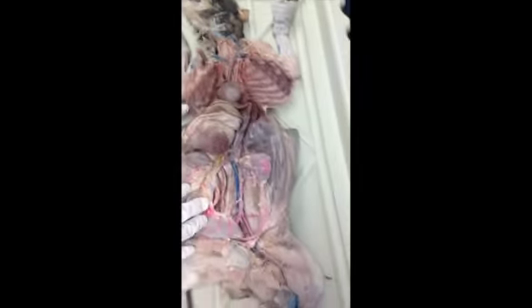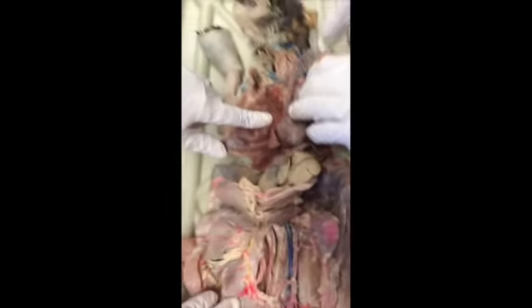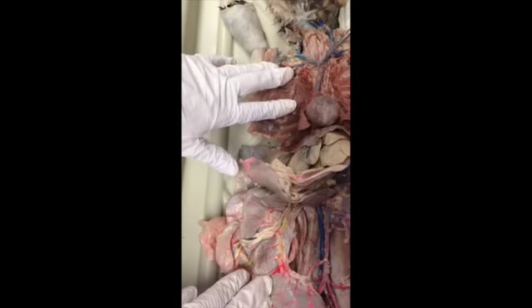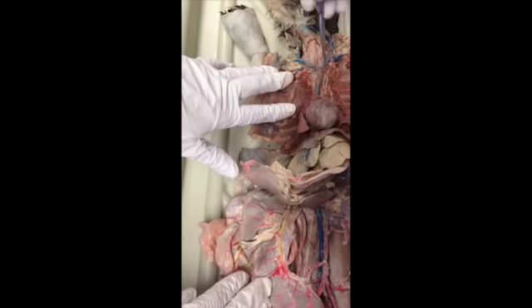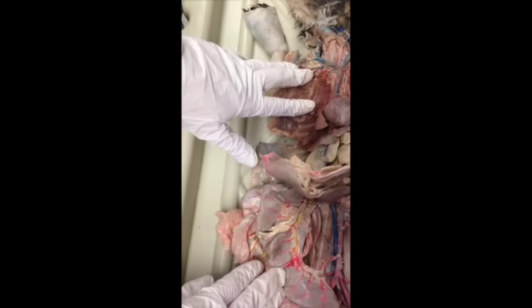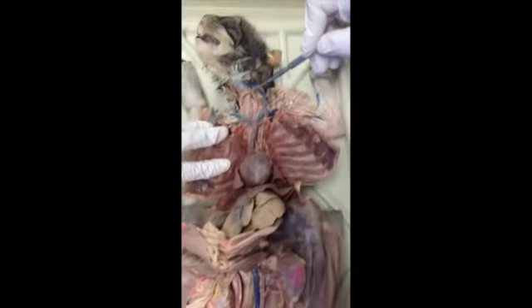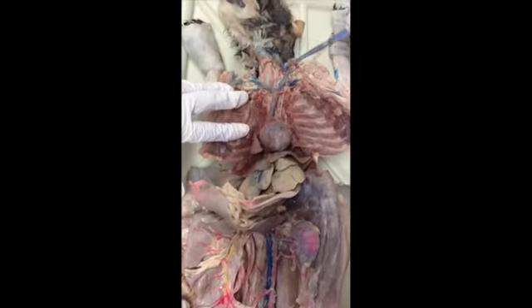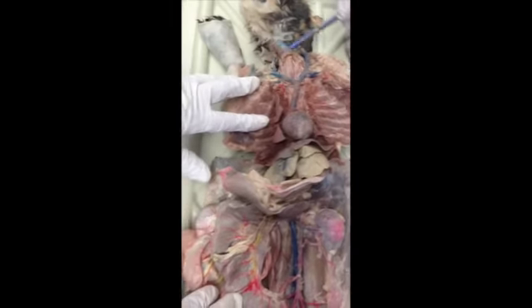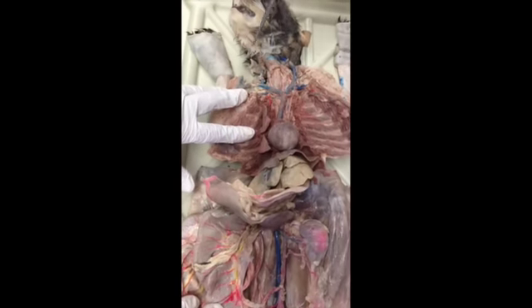Okay, let's go to veins. Coming off the heart from the top is your superior vena cava. It branches into the left and right brachiocephalic. That's just brachiocephalic veins, not trunk. Our cat does not have an internal jugular that's intact, but know that if there is an internal jugular, it's much smaller and it's on the inside. And then we've got the external jugulars on both sides, left and right. The thick one going up into the neck is your left and right external jugulars.